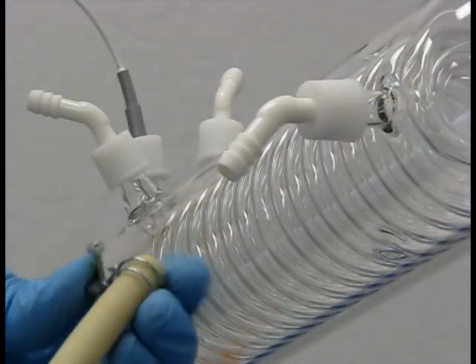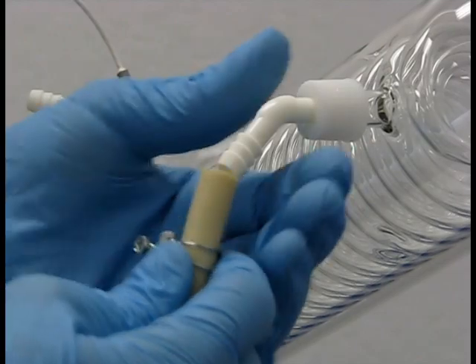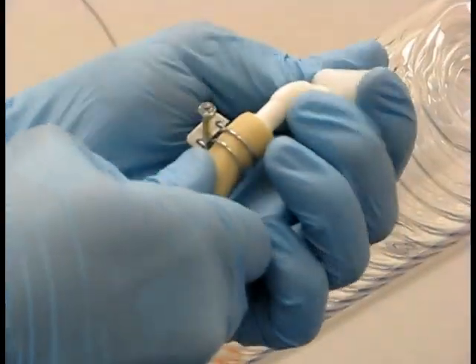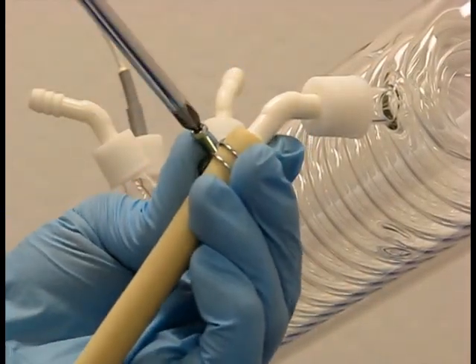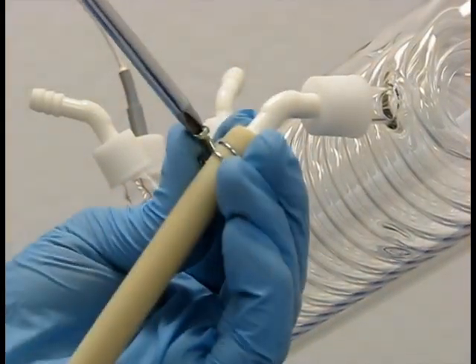Connect one end of the vacuum hose to the hose nozzle and secure it with a hose clamp. Connect the opposite end of the hose to the input nozzle on the back of the vacuum controller.